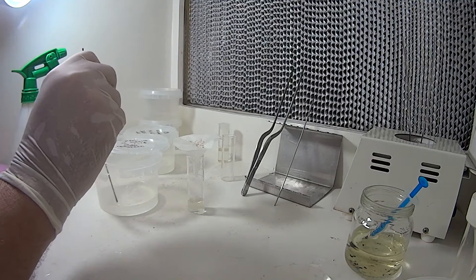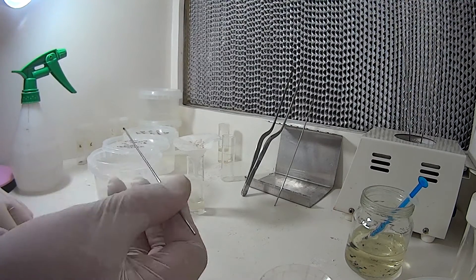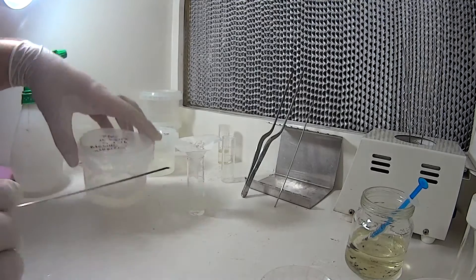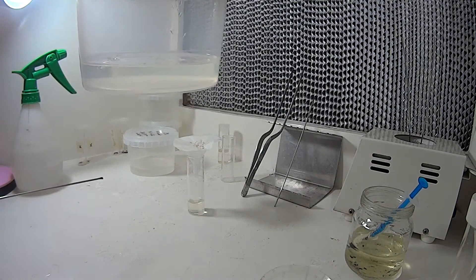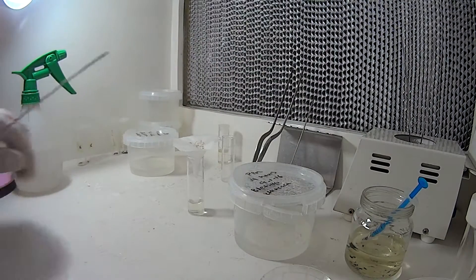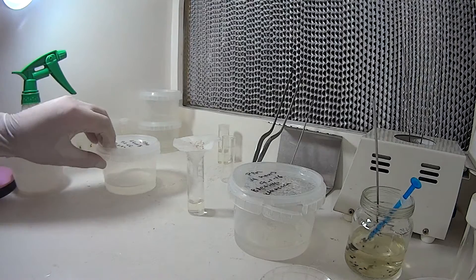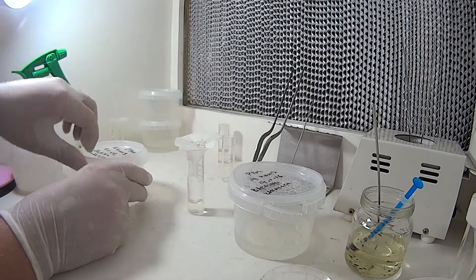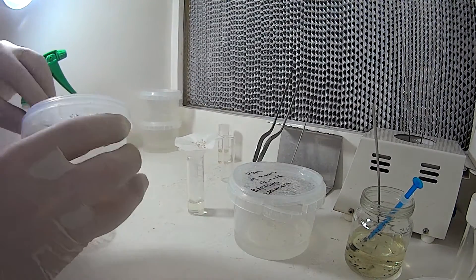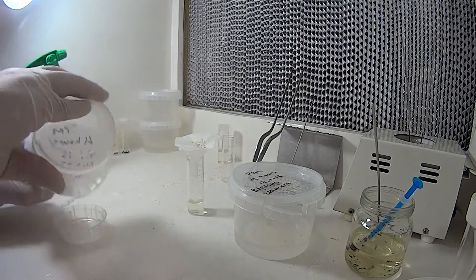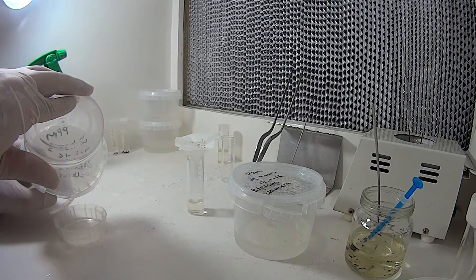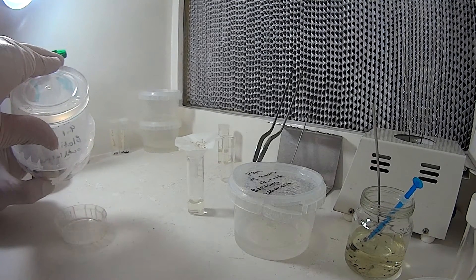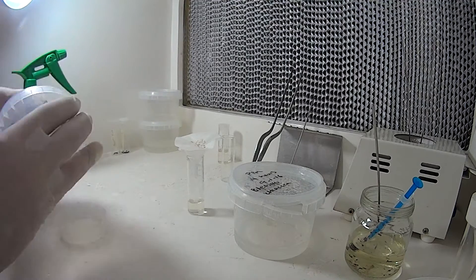Sometimes it's quite hard to get off the spatula. Alright, we've got enough in there. But it's very hard to see I've spread most of it around but it's still a little clumped up. We'll deal with that later on. Now with the remainder of the seed as you can see there's still quite a lot of seed stuck to this filter paper. The easiest way to deal with that is in a container of course. Drain the water out as per the first one.